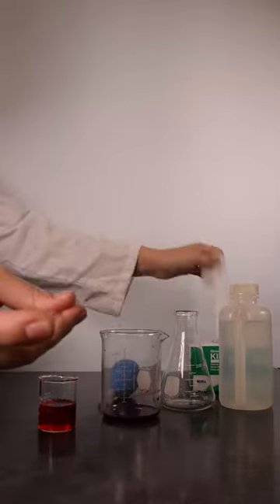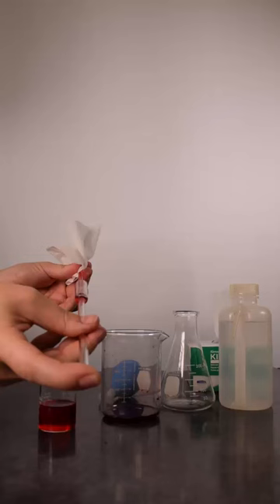Remove the pipette from the beaker and hold it horizontally to help prevent the solution from draining out of the pipette. When rinsing, it is not necessary to use a kimwipe to wipe the outside of the pipette tip, but it is a good habit to practice.